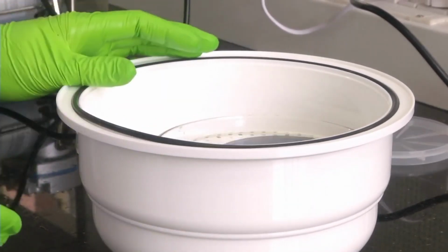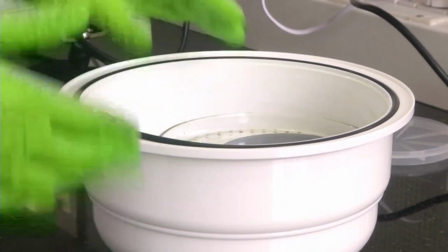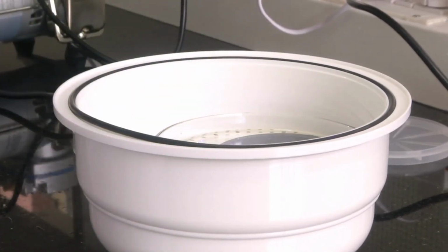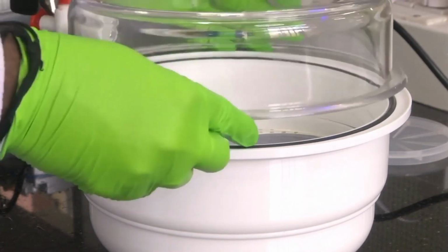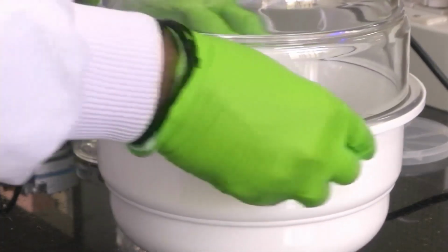So we have kept the petri dish with the PDMS curing agent mix. After removing air bubbles, we have put it on the mold. Now the mold, PDMS, everything is there. While pouring the PDMS on the mold, some air bubbles got formed. So now we are again closing it. These air bubbles also we have to remove.